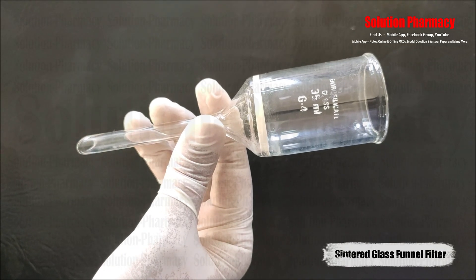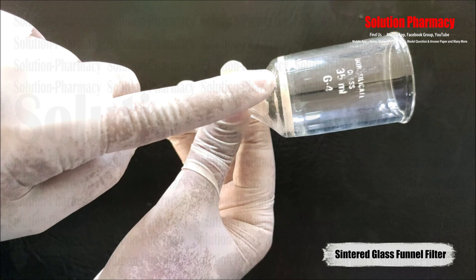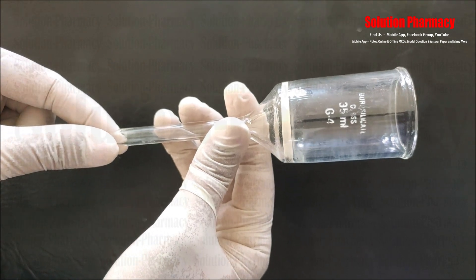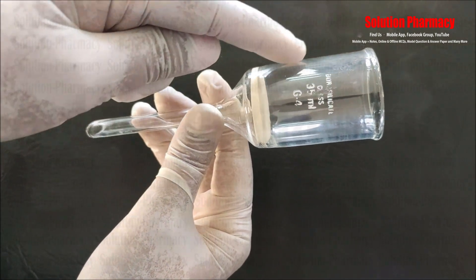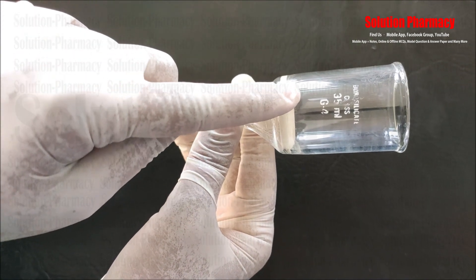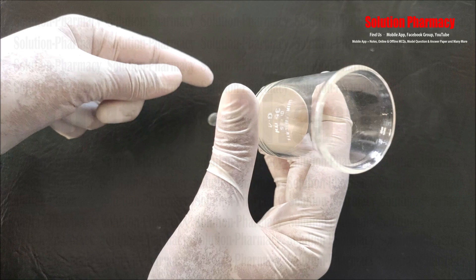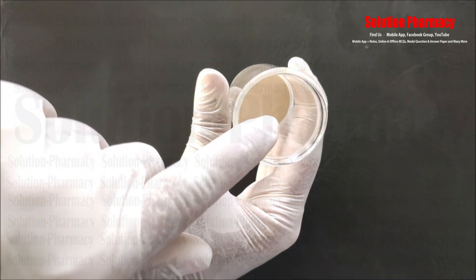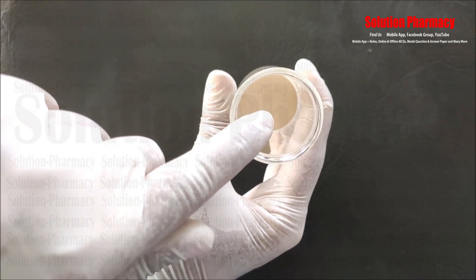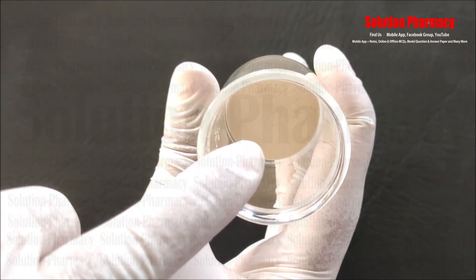This is called a sintered glass funnel filter. There is a sintered glass disc at the top, and an opening through which the filtered liquid (filtrate) comes out. The shape is like a funnel and it is made up of borosilicate glass with a 35 ml capacity. This sintered glass filter is of G4 grade — different grades are available based on pore size, and G4 grade has a pore size ranging from 5 to 15 microns.